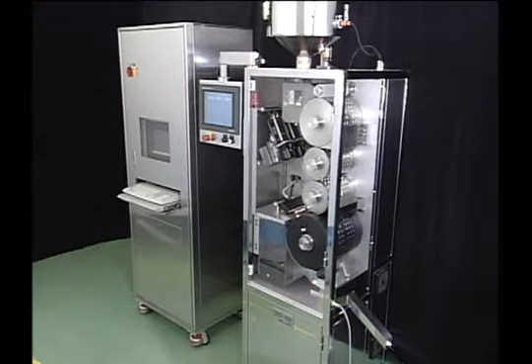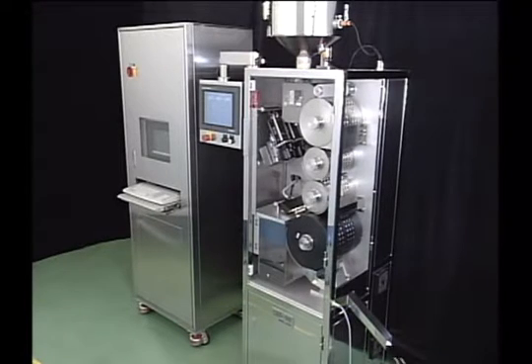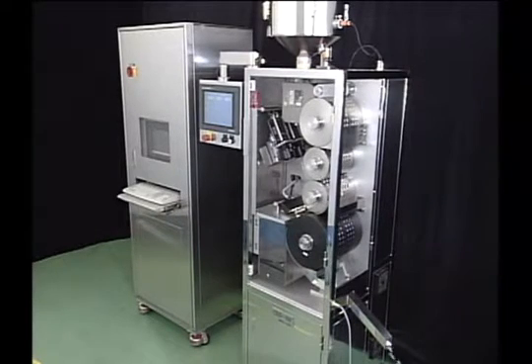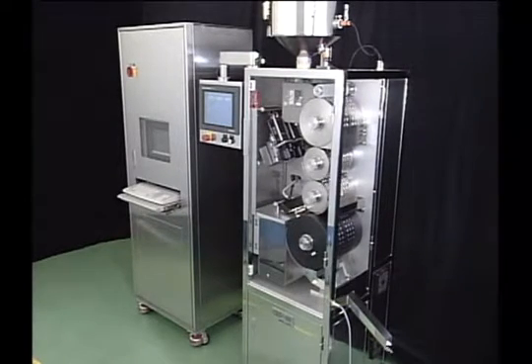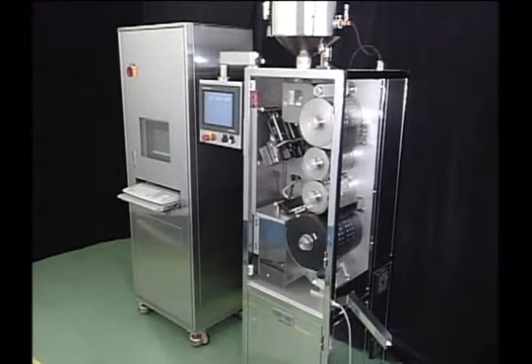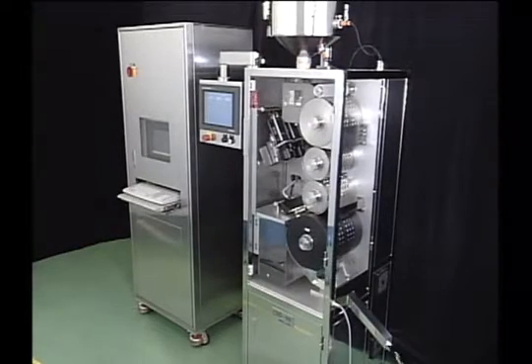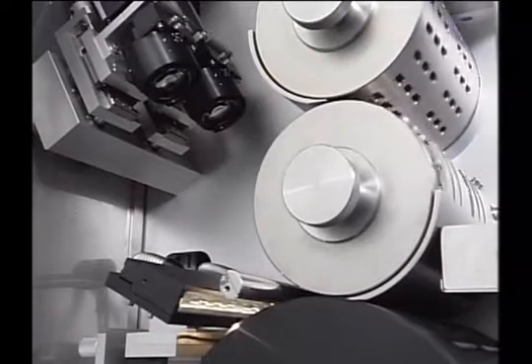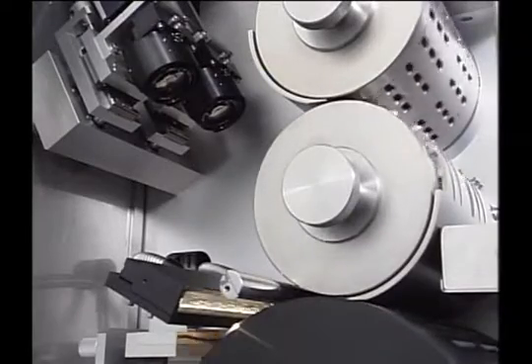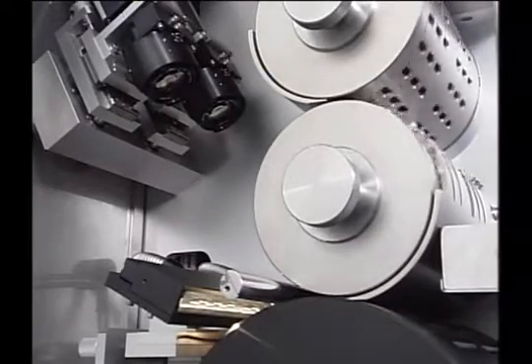The capsules are checked by direct viewing with the camera. This allows inspection of the orientation and rotation of capsules under the same conditions. Therefore, we can achieve a large increase of good quality products.